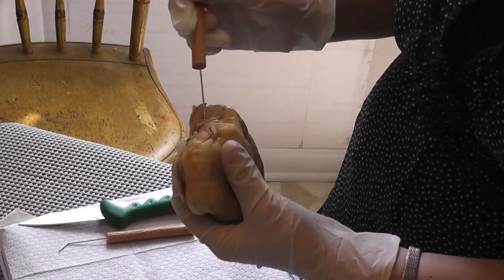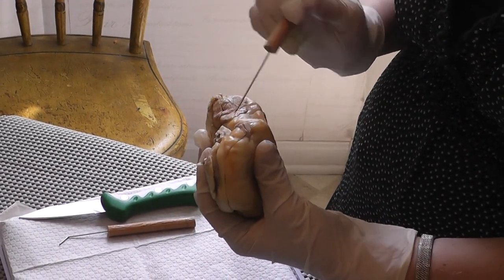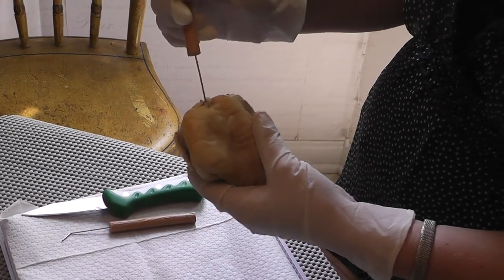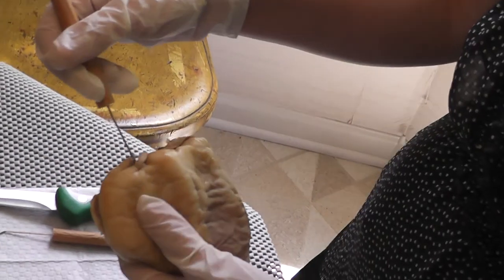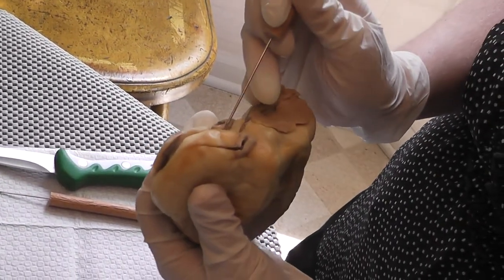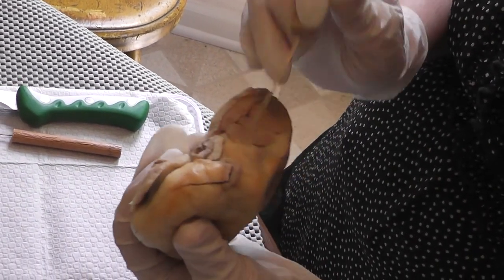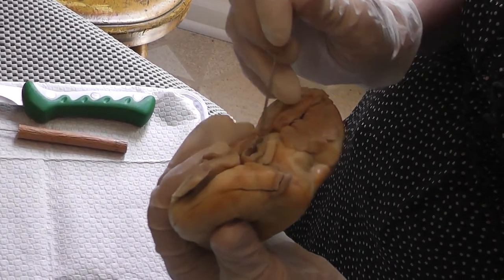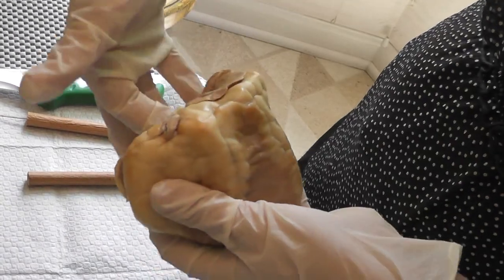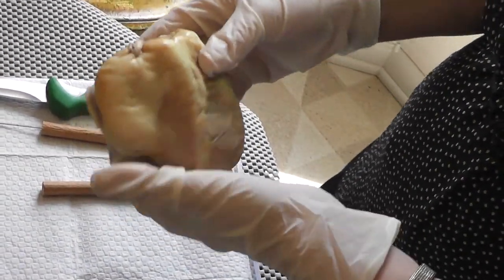Now this artery right over here is the pulmonary trunk, and the branches of it have been cut off from the heart when I got it. This is the pulmonary trunk, and it exits from the right ventricle. And this large artery right here is a very thick-walled artery. Posterior to the pulmonary trunk is the aorta, and the aorta exits from the left ventricle of the heart. If I put my finger in there, it's going to go into the left ventricle.